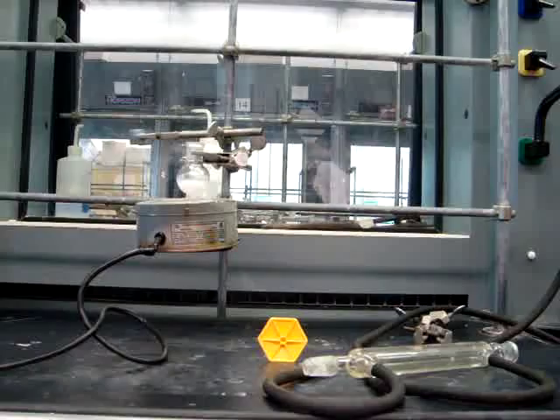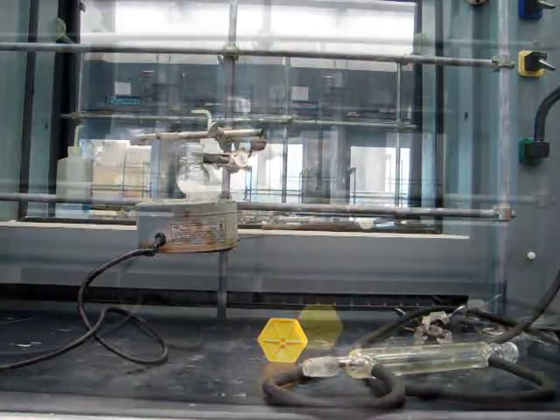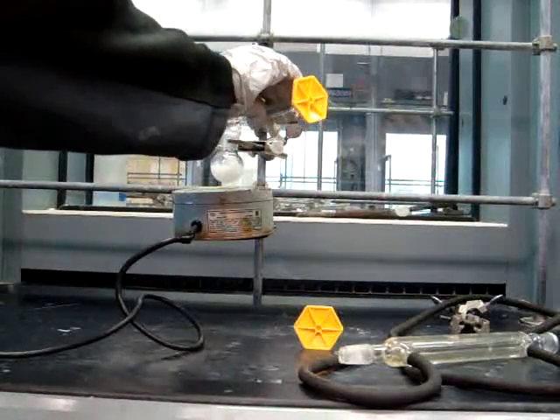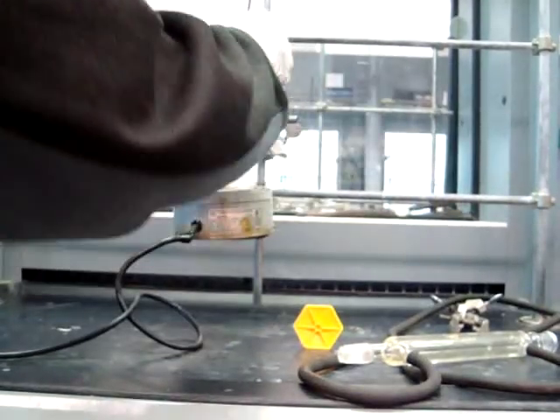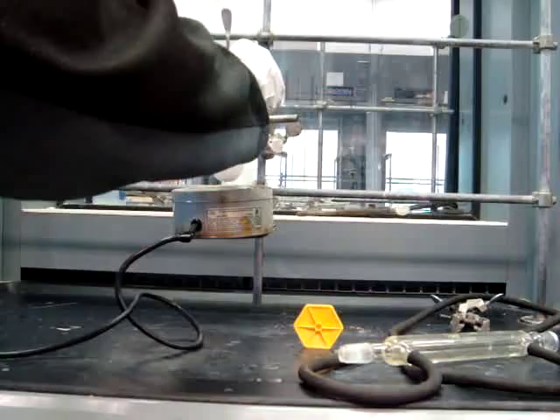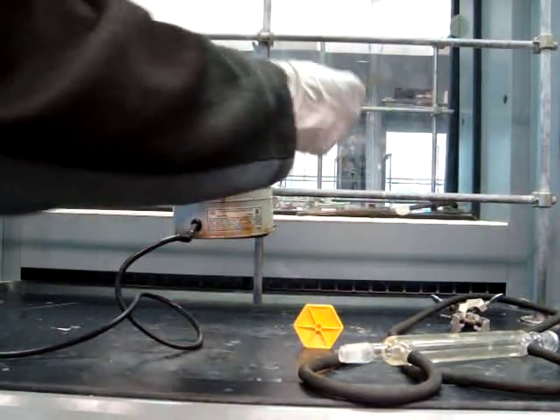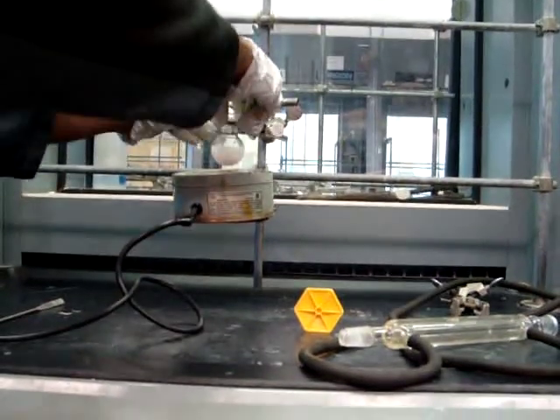Make sure that you're adding the 12ml of iced water very carefully. You may need to scratch the inside of the flask in order to precipitate more crystals. As you can see, white precipitate has started to form.